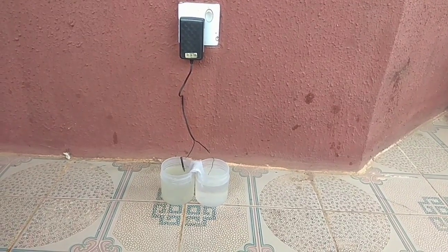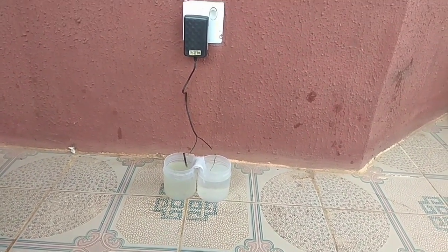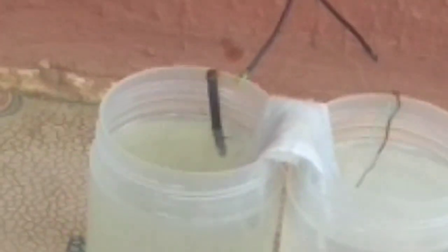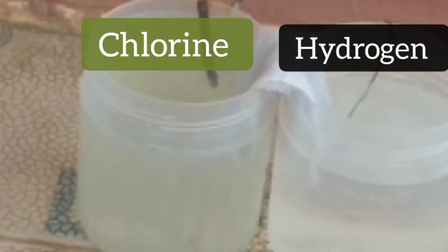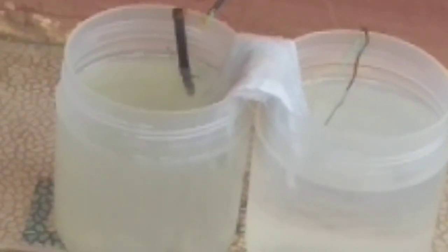I'm back here the second day and, as you can see, my electrolysis reaction is still proceeding. If you notice, this first container is clear and that's where our sodium hydroxide will form. But this container is cloudy and pale yellow. The cloudiness is not a problem because I can always filter it, but it's pale yellow because chlorine gas is being dissolved in the solution. This proves to us that chlorine gas has been emitted, and that's why it's important that you are practicing this experiment outside.